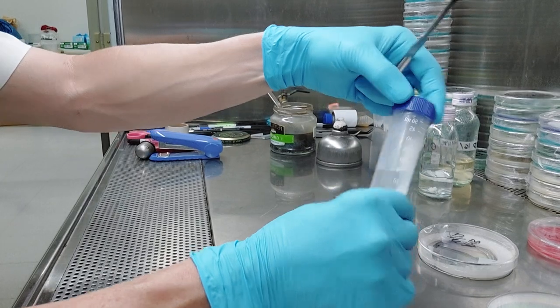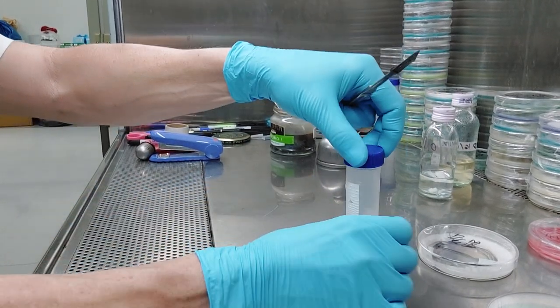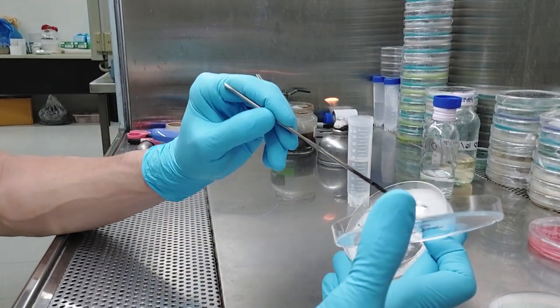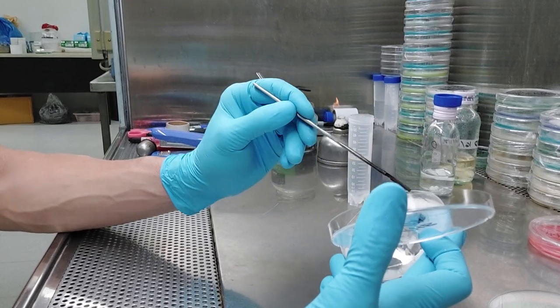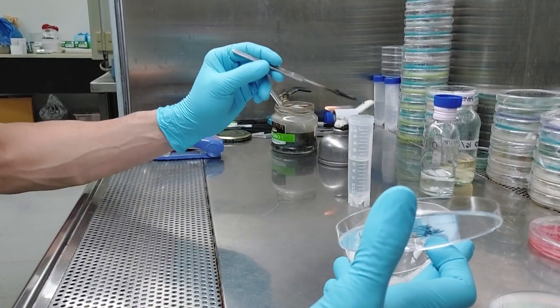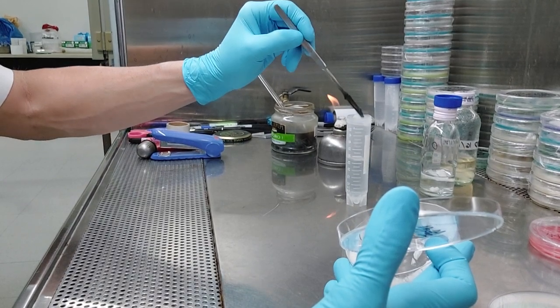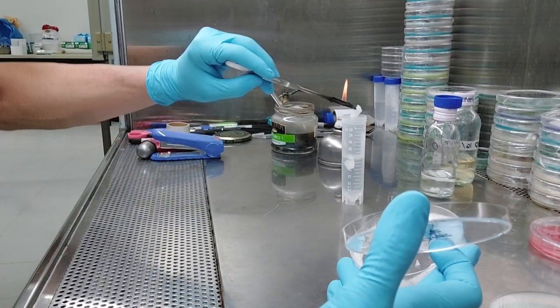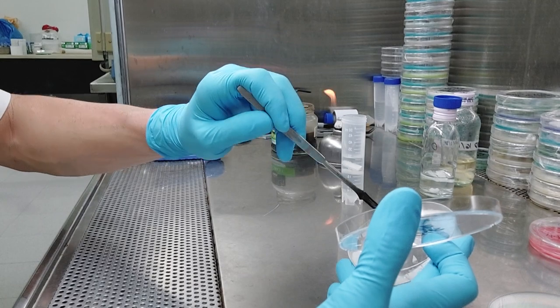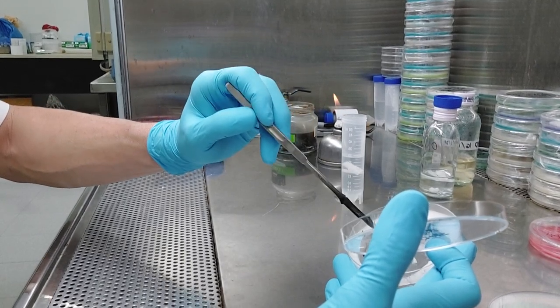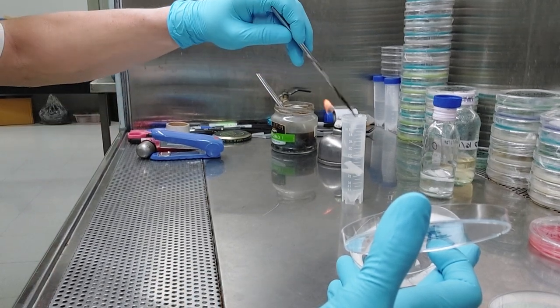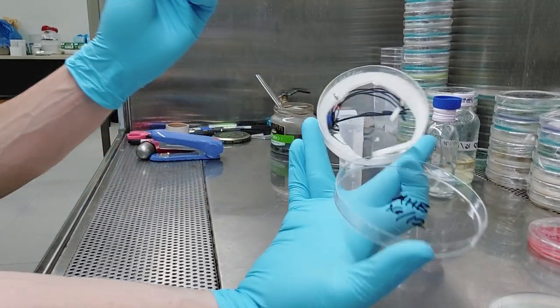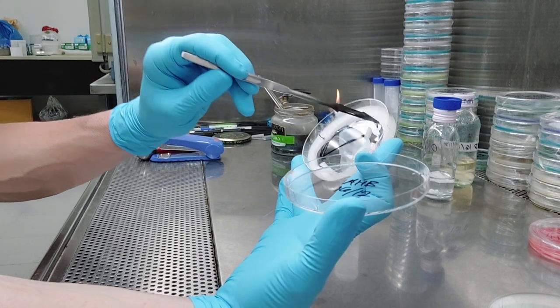And I've been loving these things primarily because they stand up like that. That's awesome. So I'm going to carefully. The different manufacturers, again, I'm going to cut strips. Different manufacturers, they don't have to be strips. You want to get chunks. Some people, you guys, with your agar punches and whatever, don't bother. Seriously, like it's a waste of time. The more time you spend with this plate open and the more time you spend punching little symmetric circles out of your agar. Notice how I'm touching the inside. That's okay. Just don't touch the outside. See, look. Oh, now see that one touched the side of the agar plate. I'm not going to use that. I'm going to go over here. Notice how I'm still staying away from the edges, you guys?